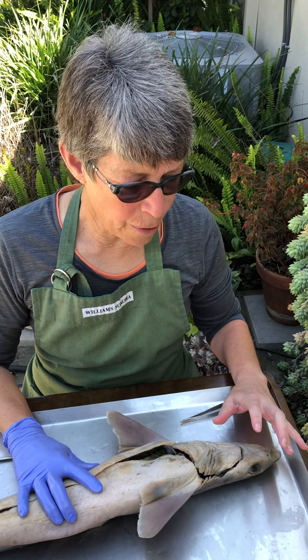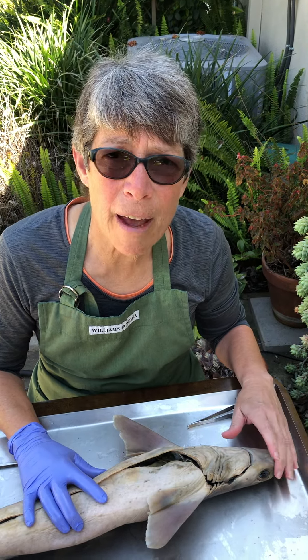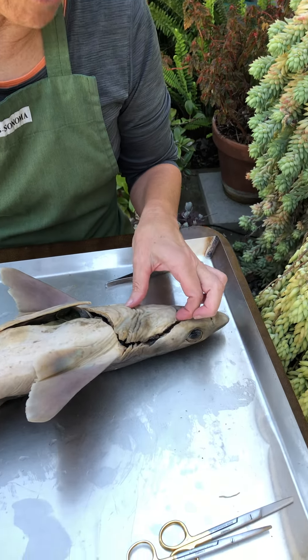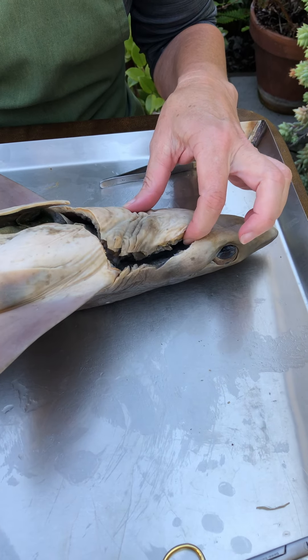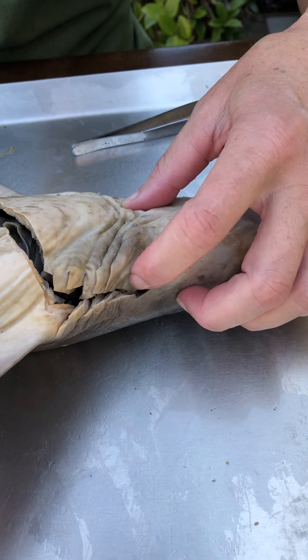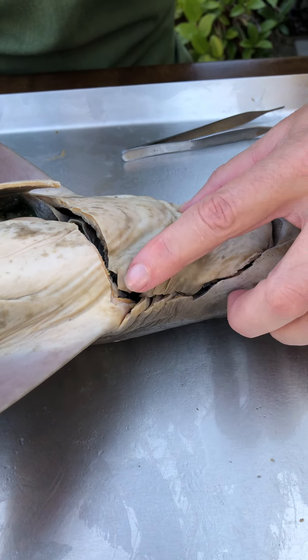This shark video is going to be about how to get into the cavities — the pharyngeal cavity and the peritoneal cavity. To get into the pharyngeal cavity, you have to cut through the jaw as close to the jaw joint as you can, and then actually bisect this row of gill arches.